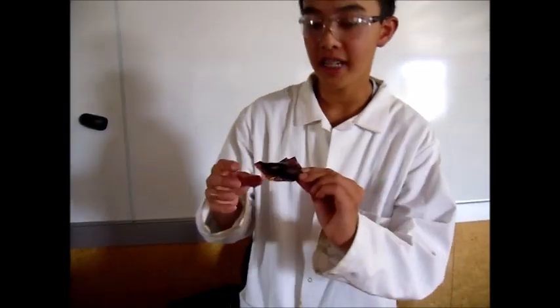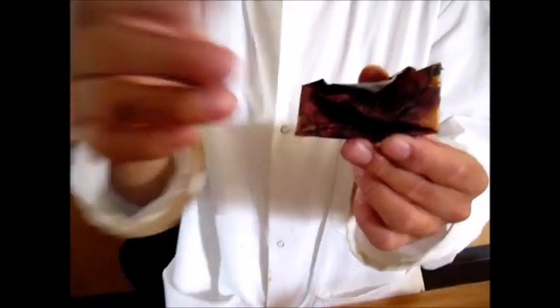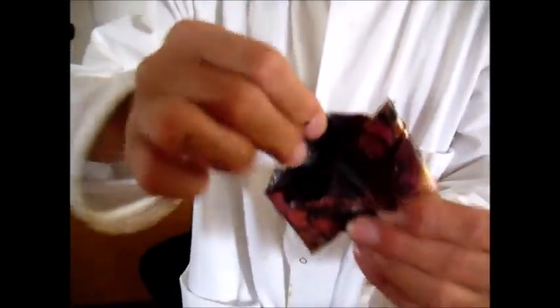After 5 minutes of heating, the copper envelope is truly black on the outside. Now, this is a layer of copper 2 oxide, and it actually comes off quite easily.